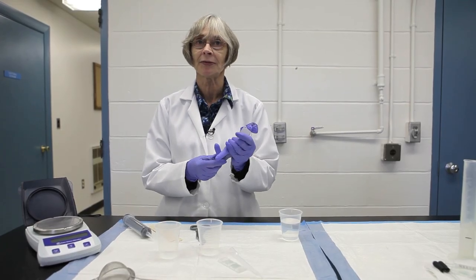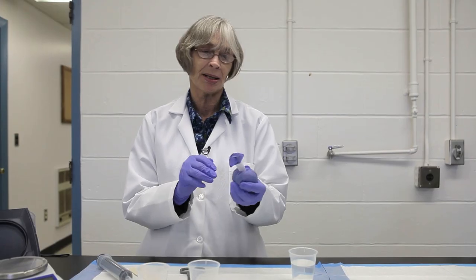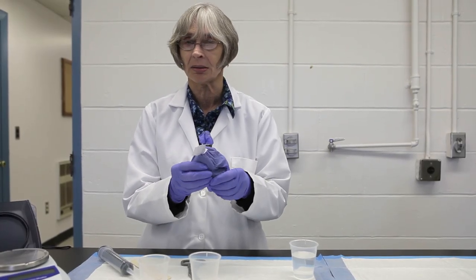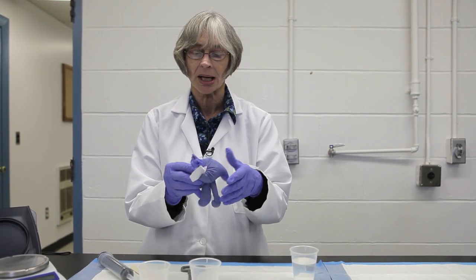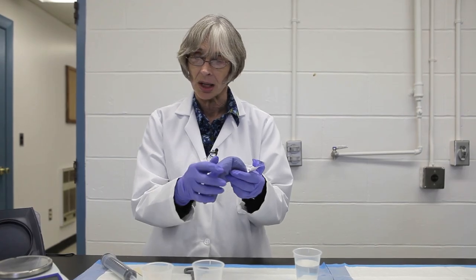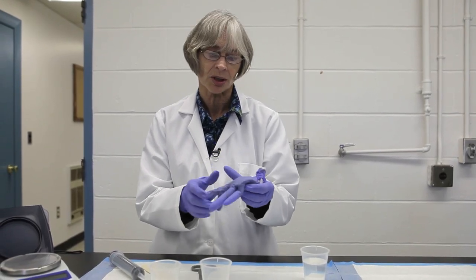You have your fecal sample in a glove. First, do as much as you can to make sure the sample is well mixed — just squeeze the feces around, which also gets the eggs distributed more evenly in the manure. The eggs are not evenly distributed throughout the animal's manure. This is particularly important if you've used a composite sample — if you've taken feces from several animals and mixed them together, it's absolutely critical that you mix it well. Also, if you have solid pellets, it's easier if you can kind of break them up a little bit in the glove first before measuring them out.